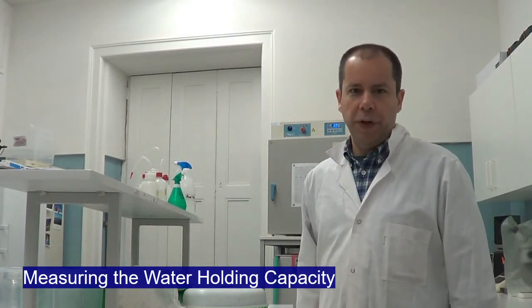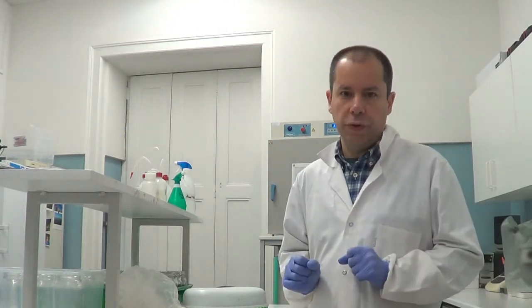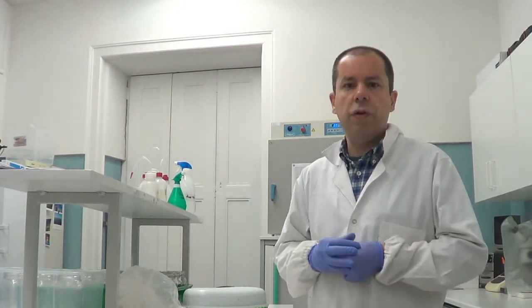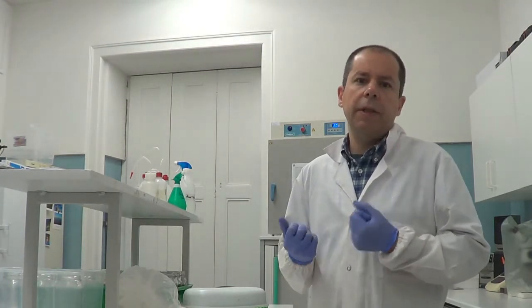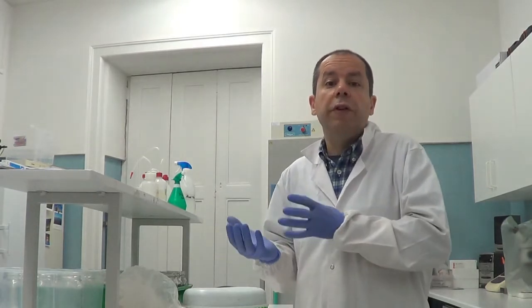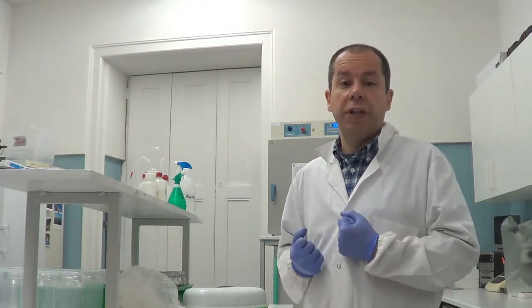One very important point when we want to start a test with soil organisms is to adjust the soil moisture. For that, we should take into account the soil properties, namely the texture and the organic matter content. For instance, a soil with a coarse texture has larger particles, which means it retains less water than a soil with fine texture, which has fine particles and a higher ability to retain more water.